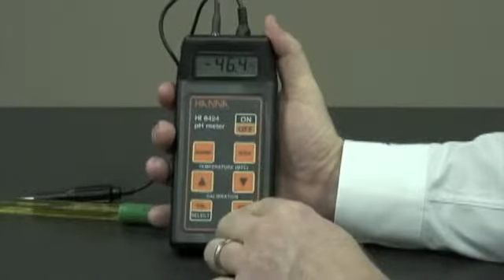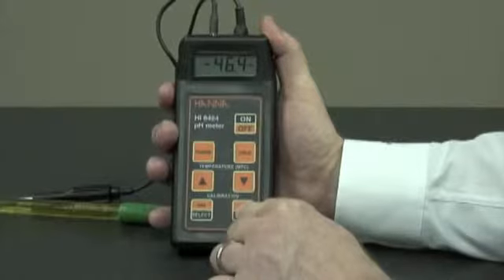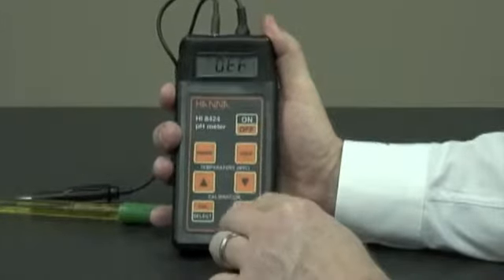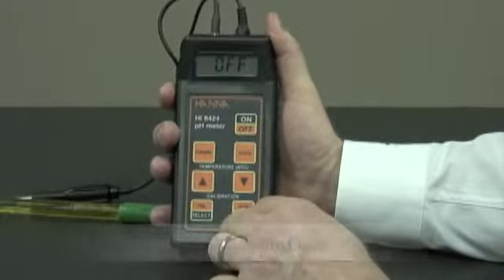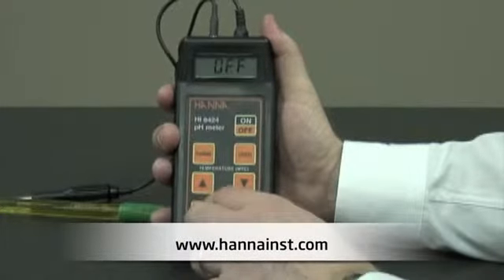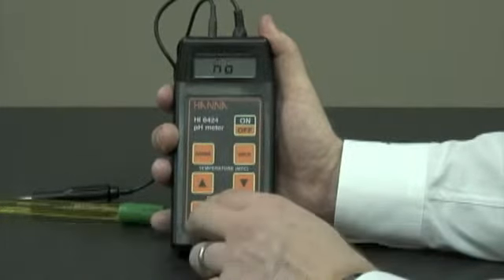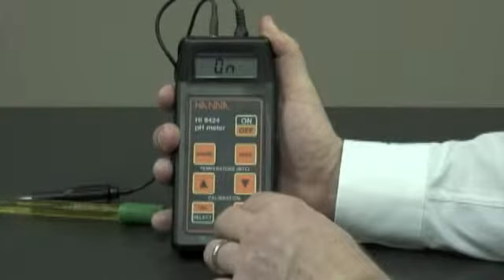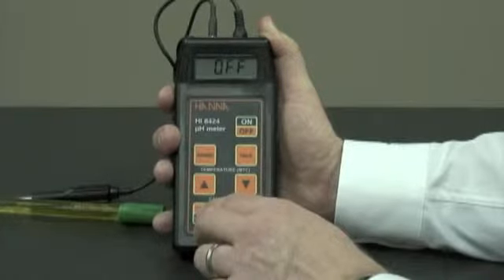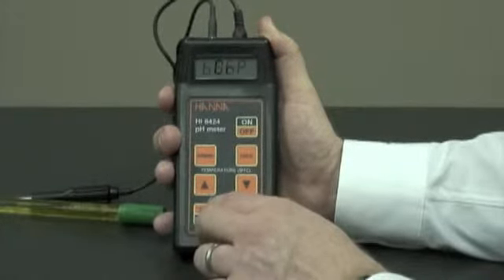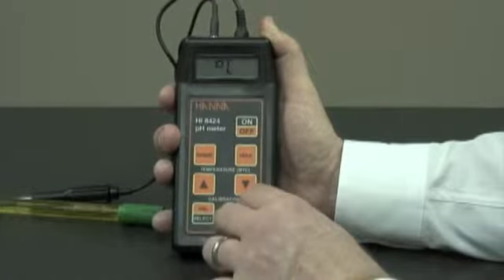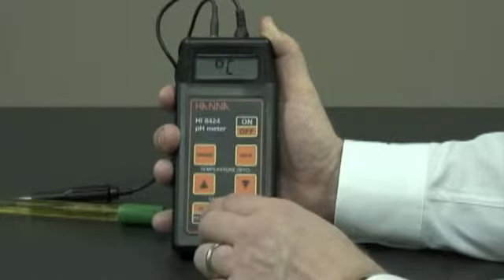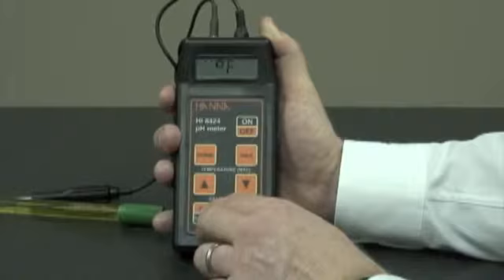The setup button, if you hold it down for three seconds, you can use some of the features. You have the auto-off feature, you can time it so that in 20 minutes the unit will shut off the power or not. You can also turn the beeps on or off, and you can switch manually from Celsius to Fahrenheit.